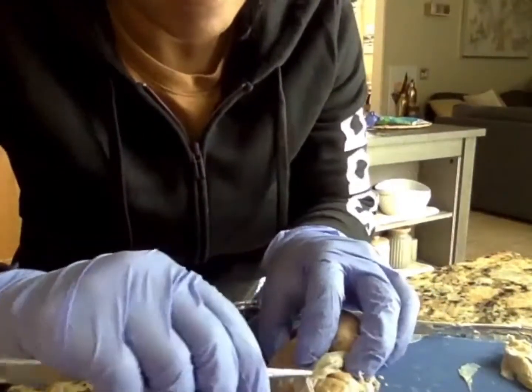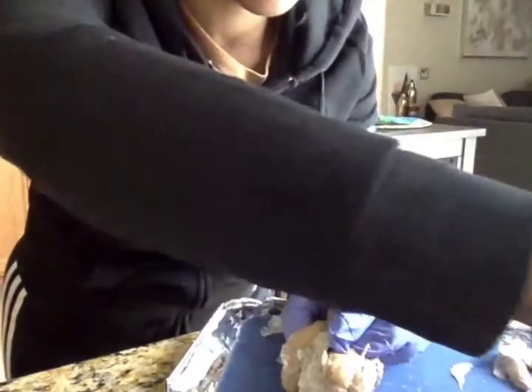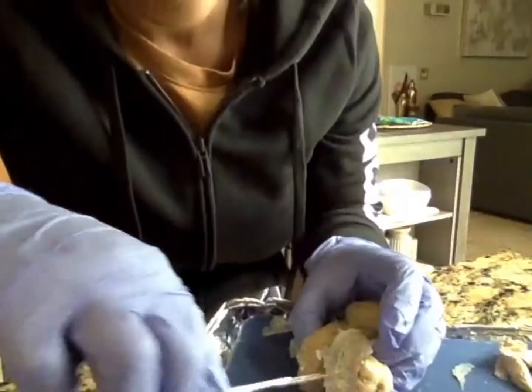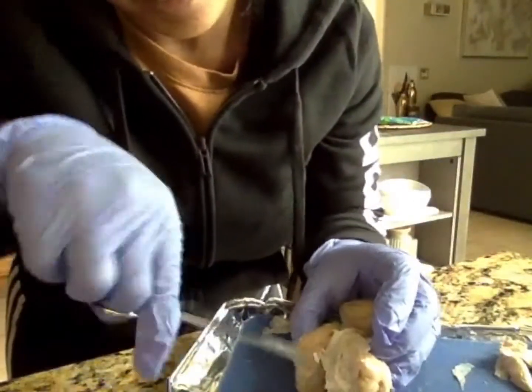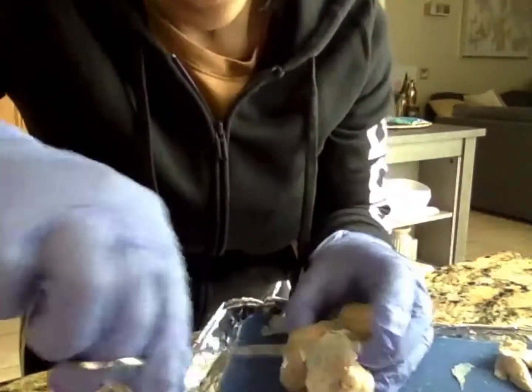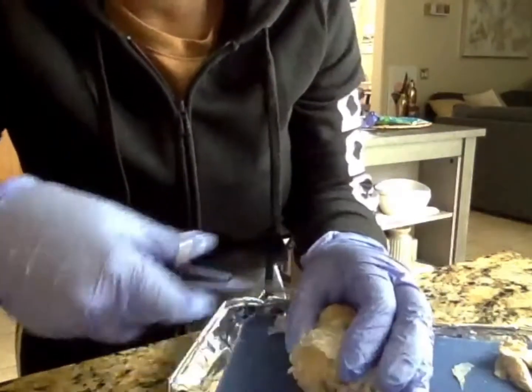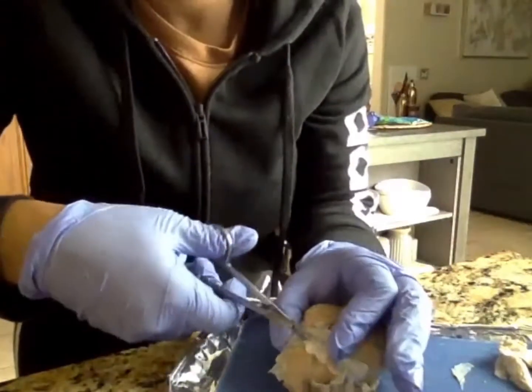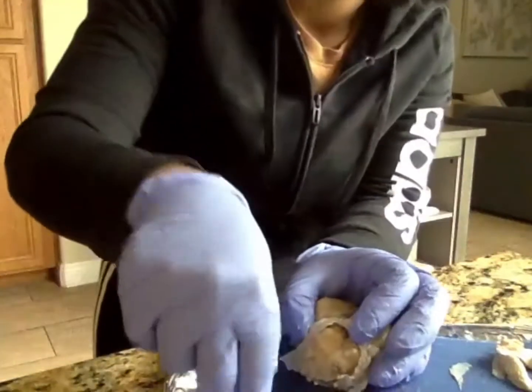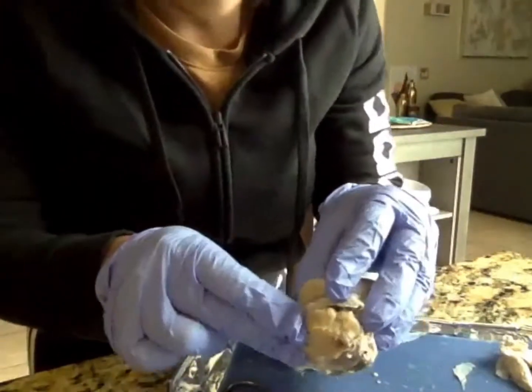Remove some of that meninges so we can see the cerebellum. Cut a little more away at it to see it more clearly. Okay, so you can see the cerebellum. We moved some layers there. So that's the cerebellum, the big meaty part in the back. All right.